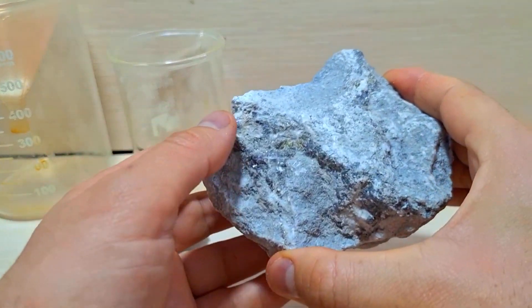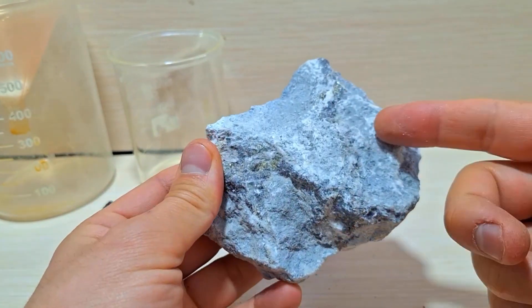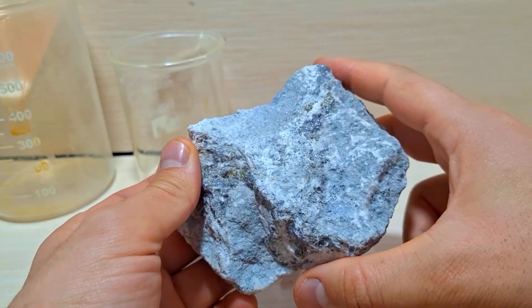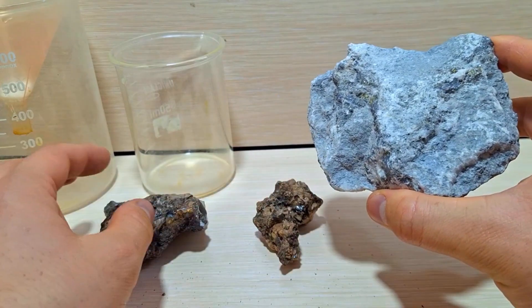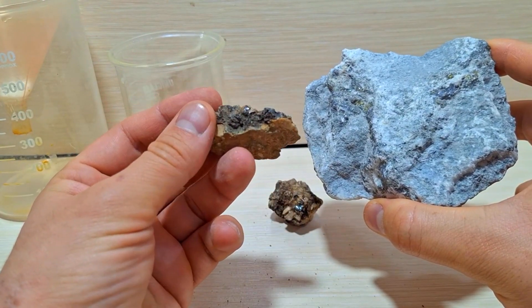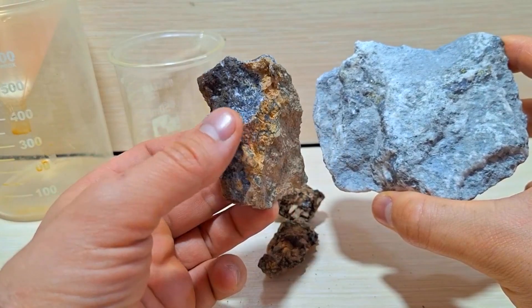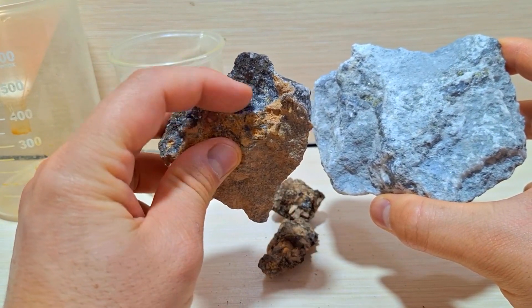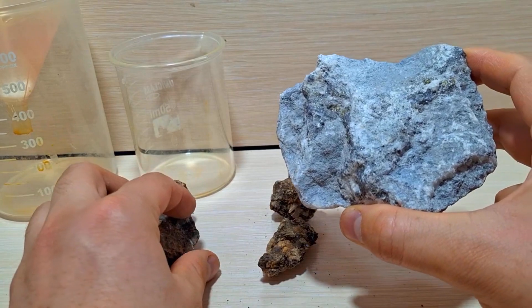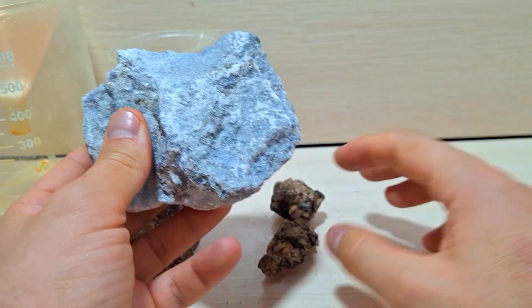I also plan to work more professionally in future videos. Please note that this experiment is not for making a professional battery. I just want to demonstrate lithium extraction and build a simple and basic battery, so don't expect too much. These two minerals have a good percentage of lithium, and I'm choosing this one for the test. I have already powdered some of this rock.